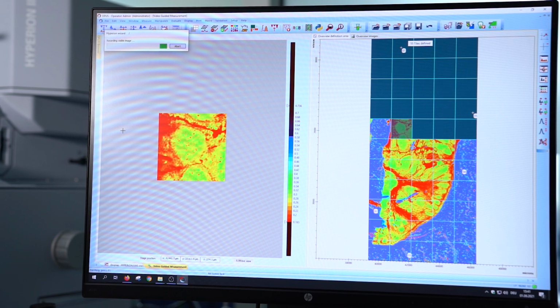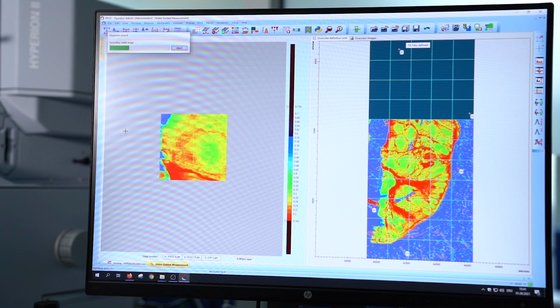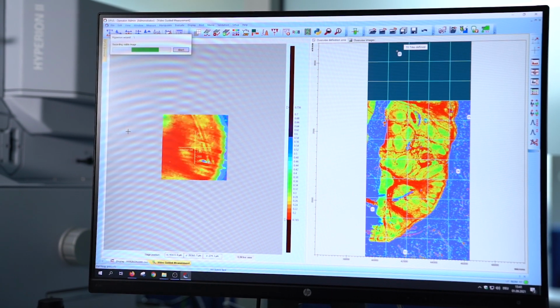It is finally possible to record large infrared overview images with amazing quality in very little time. It honestly feels like recording a visual overview image. This will help everyone from scientists to universities. I think this is a really great solution for everyone who wants to directly observe samples in the infrared and unlock the possibility to create large high quality data sets that are perfect for use in machine learning.